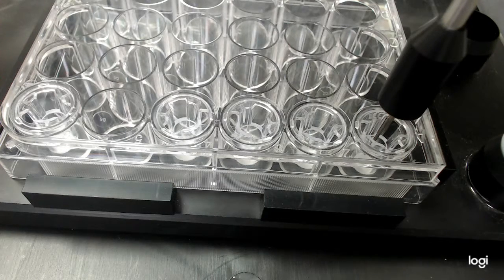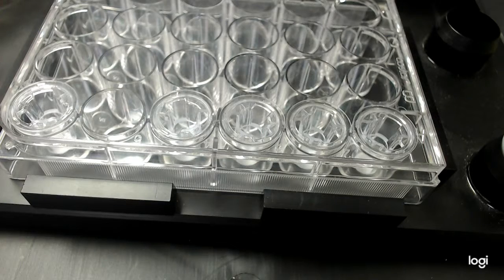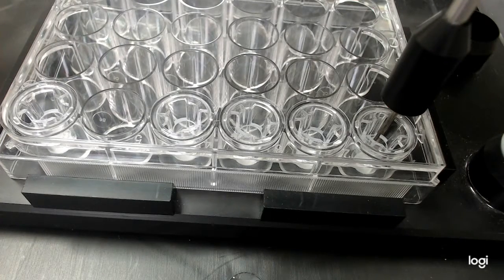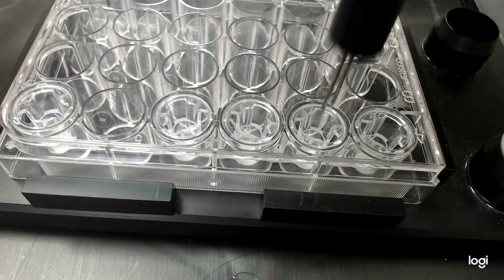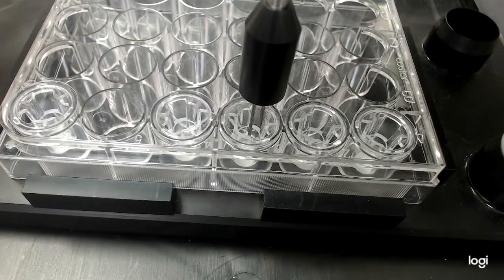First, I'm sending the electrode back to home, and then telling it to go back and read the samples. And start. I've set up a 3 second reading gap, so it will go to the next well. Then I'm going to send it to the next well. The fourth one, I've intentionally set in a wrong orientation.